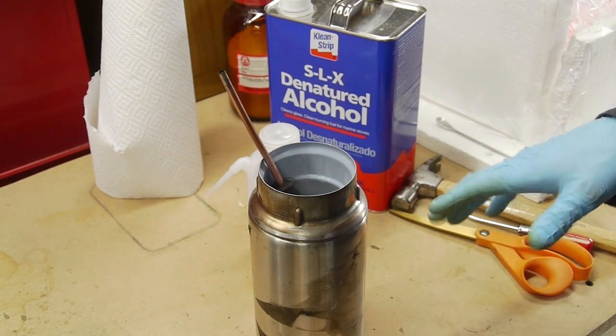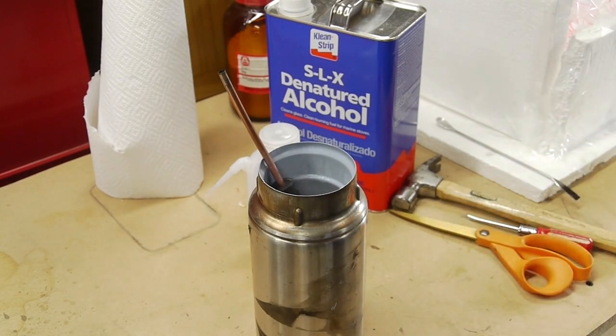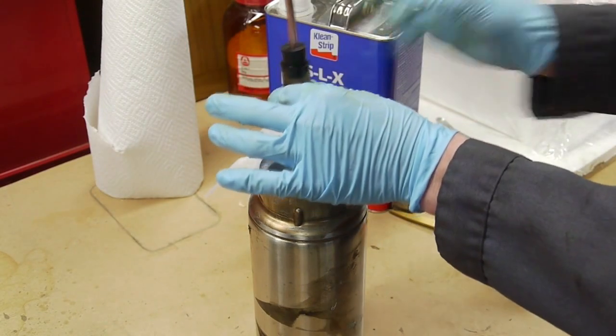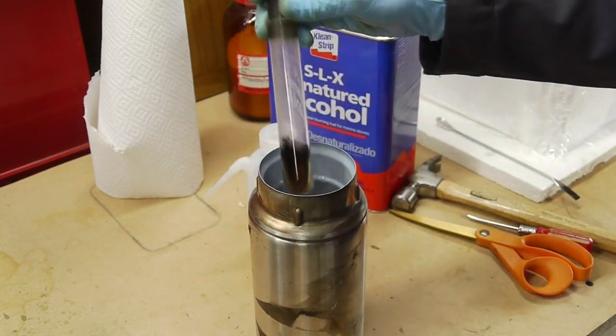This ended up working okay. I was able to get clear liquid in the test tube that I'm pretty sure was anhydrous ammonia, but I uncorked the test tube, just took this off of here and left it sitting in the cold bath for a while.